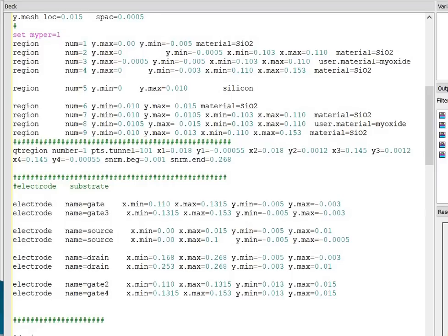Region number 4 with the positional parameter and the material is again oxide. Region number 5 with its positional parameter and the material is silicon. Region number 6 with its positional parameter and the material is again oxide material. Next region is 7 and the material is SiO2. Next is region number 8 and the material is user.material, and the name of the material I had given is my oxide material. The last region number 9 with positional parameter and the name of the material is oxide material.